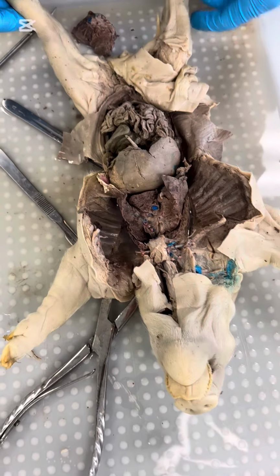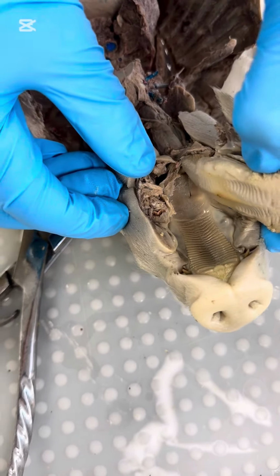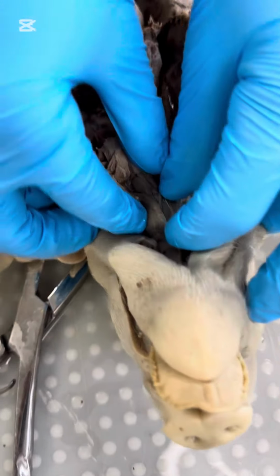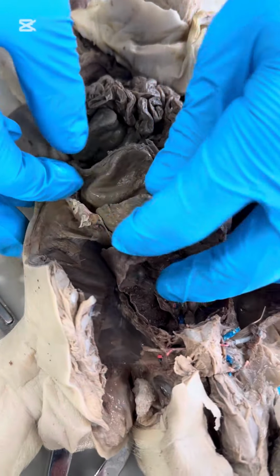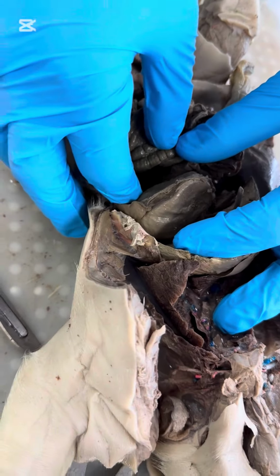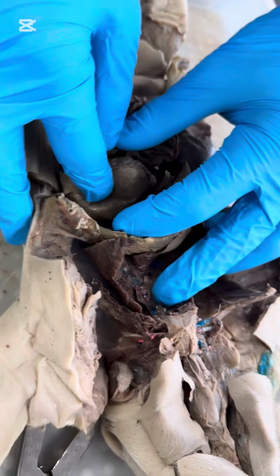Okay, now here is the passage of food from the lips to the anus. To start off, the mouth. Food is chewed and mixed with saliva to begin the digestion. Down into the esophagus. In the esophagus, swallowed food moves down into the stomach with muscle contractions. Okay, so into the stomach, food is mixed with acid and enzymes to break it down further.